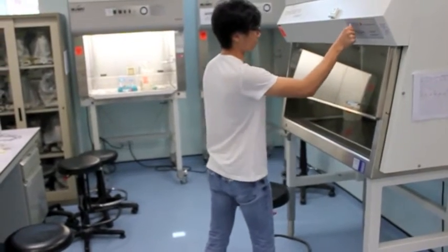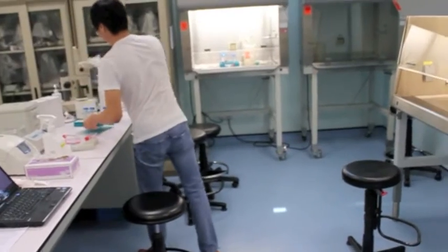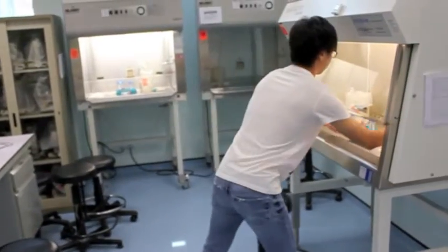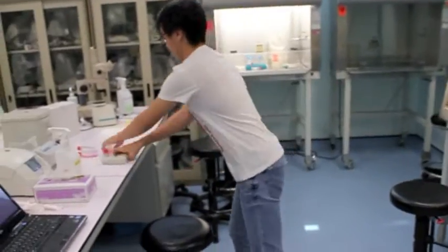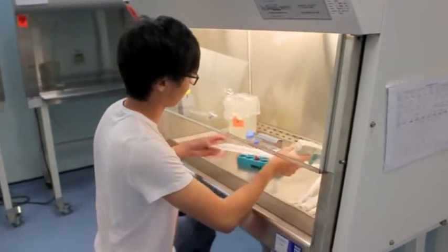Prior to performing any forms of cell culture, ensure that the BSC is UV'd for at least 10 to 15 minutes. At the same time, any equipment that is required to be in the BSC has to be sprayed and wiped down with 70% ethanol.